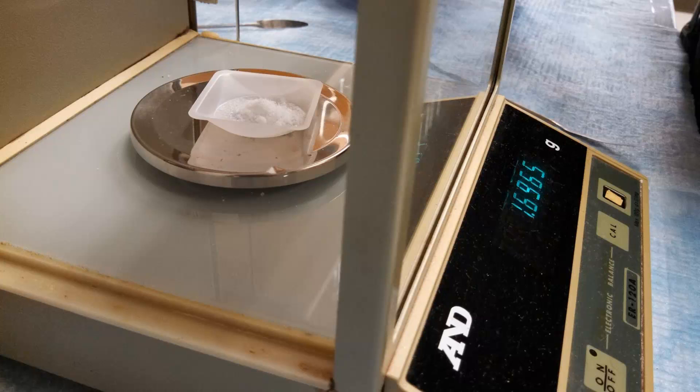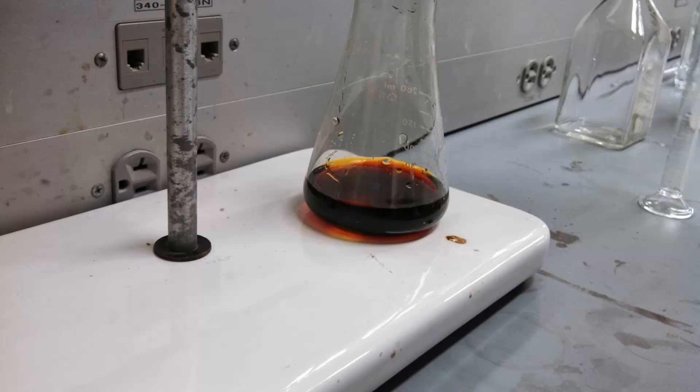Also in that reaction of interest, there was a large number of protons. And when you add that large number of protons, that's what makes the reaction go and produce I3-, which is our indicator and what we're going to be titrating away. So to add those, you're going to pour with a graduated cylinder some concentrated sulfuric acid, highly concentrated, not the very most concentrated stuff. And when you do that, your solution will turn this brown color due to the triiodide ion. And at this point, you should immediately begin to titrate with sodium thiosulfate, so you don't want to prepare all your flasks in advance. You can prepare them right up until the point where you add the acid, but then once you add the acid, you need to titrate immediately.